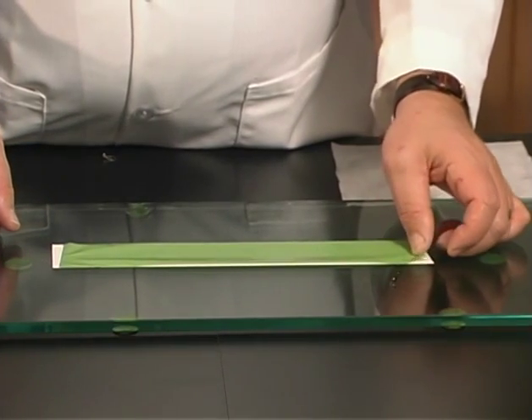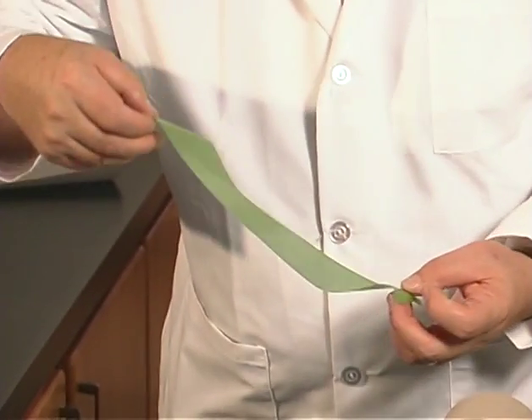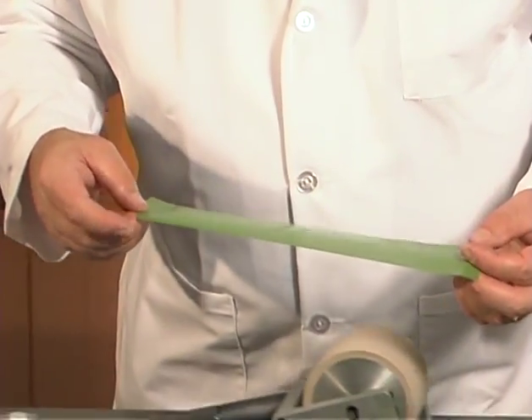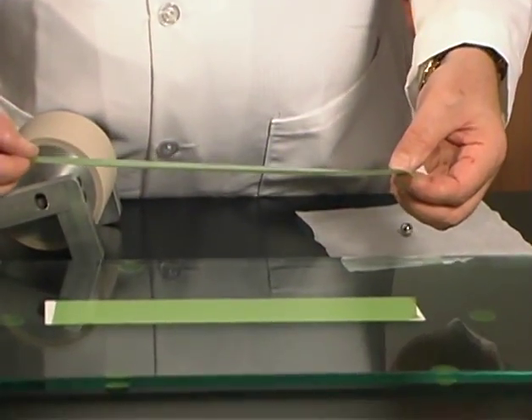To avoid contamination, we'll apply a second layer from the same specimen roll on top of the first layer, also adhesive side up.